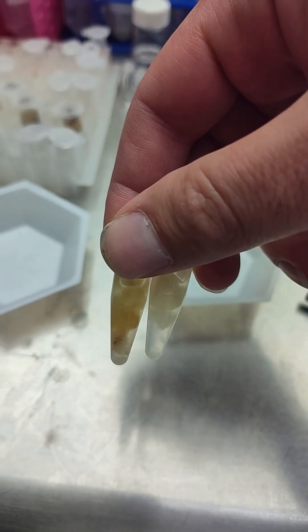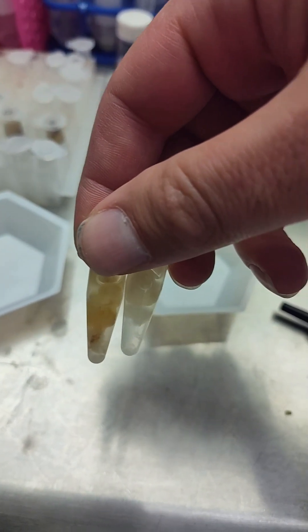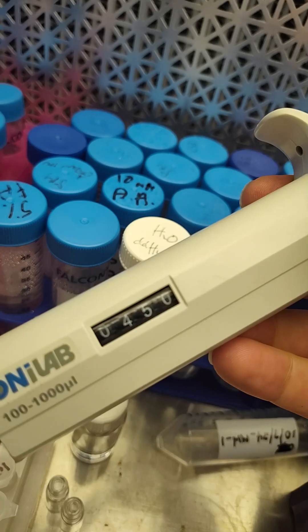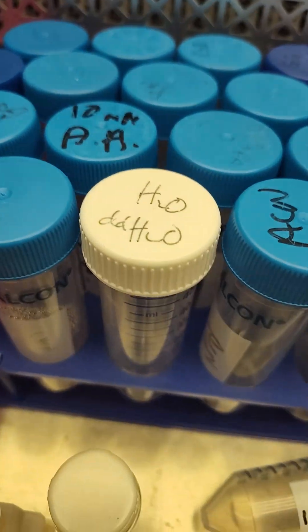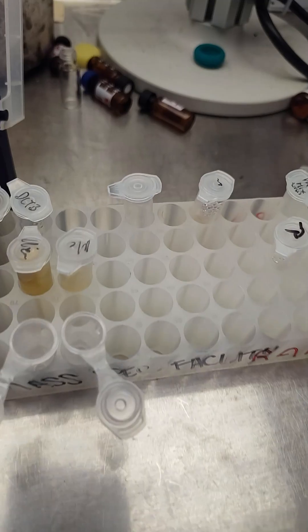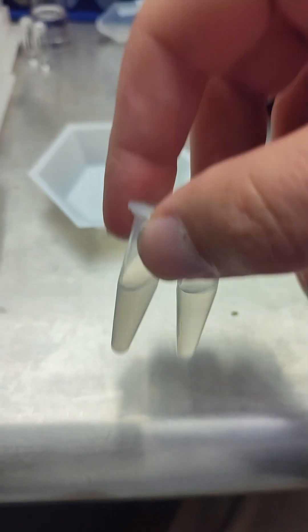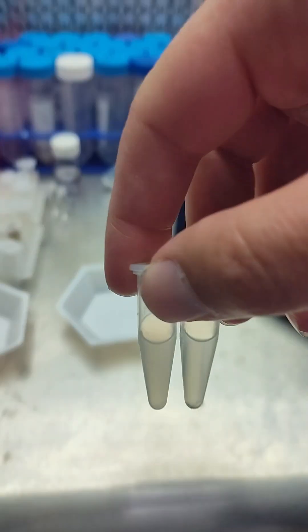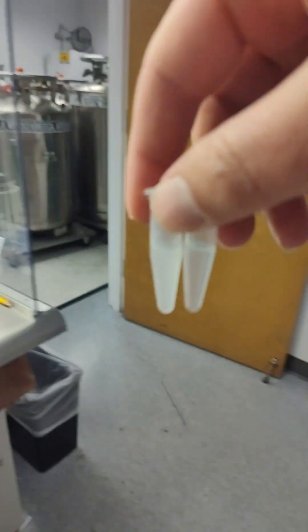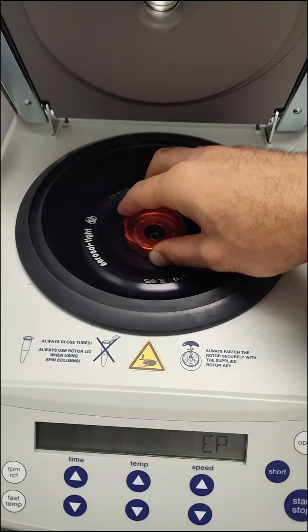Alright off the sonicator. Looking about the same color. I'm just going to do my classic dilution: 450 of that double DI water and 300 of each sample. Alright there they are diluted out. We got the Wendy's on the left. I don't know they look pretty similar. Maybe a little cloudier on the Wendy's. Alright then we're going to spin these guys out.